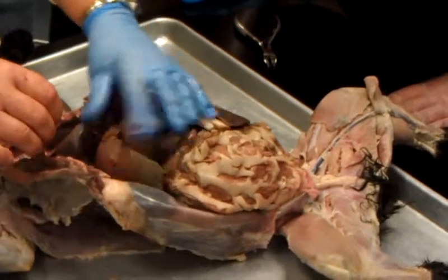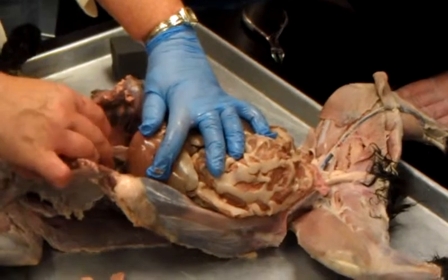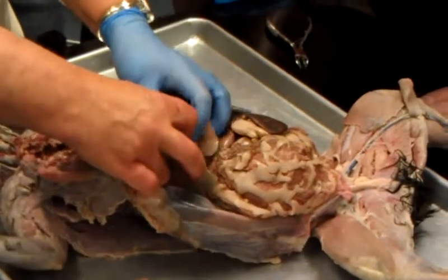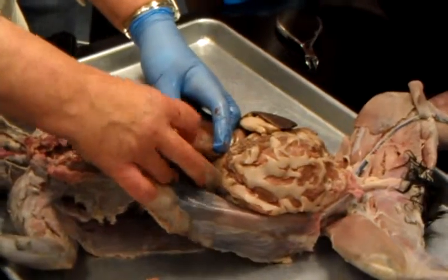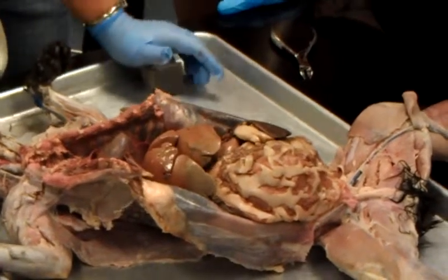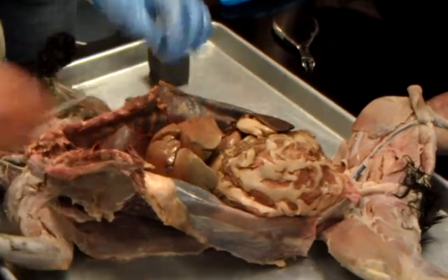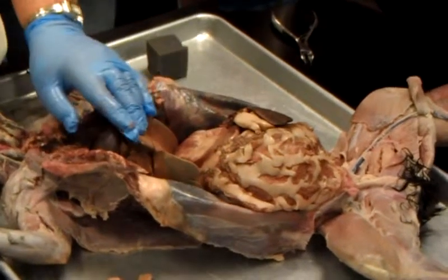I talked about the falciform ligament. Remember when we did these? Here's your falciform ligament. It comes from the underside of your diaphragm. Comes down and goes right through the middle of the what? Liver. Now on the list, I think I have round and coronary ligaments. You don't have to find them. But you should be able to find and identify that this is the what? Falciform.